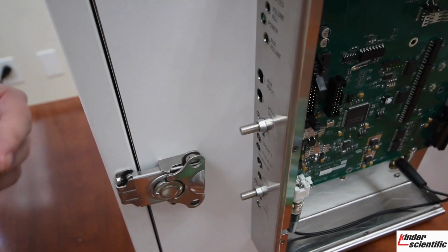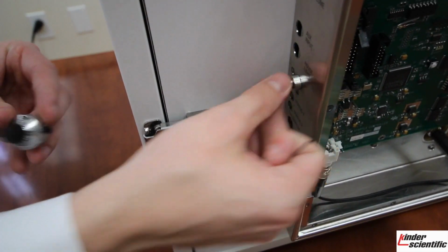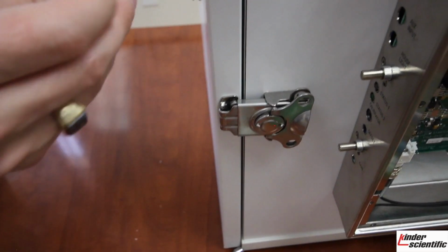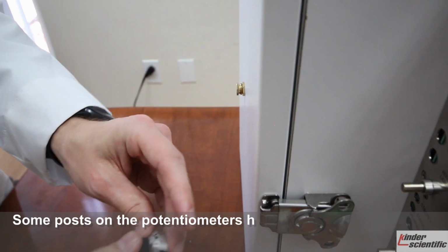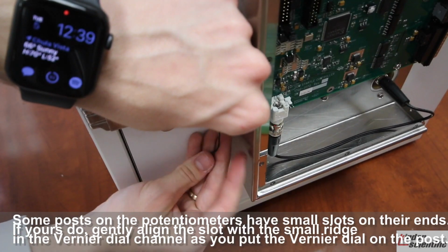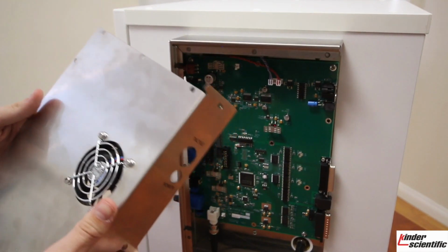Next, we will be placing the vernier dial back on. So you will go ahead and ensure that your 2 dials are all turned all the way to the left, and that your vernier dial is at the setting 00, you will then go ahead and, similar to how you took it off, this small set screw is what you will use to tighten it. So once it's on, you just go ahead and, using your small Allen wrench, reach down under and tighten it, just like so. You are now ready to place your cover back on.